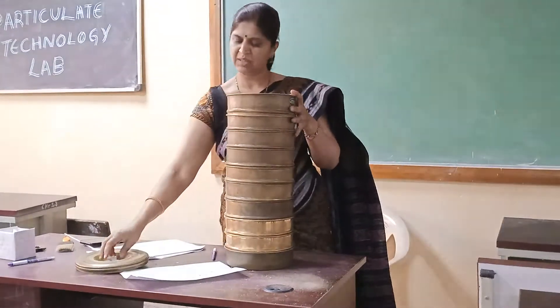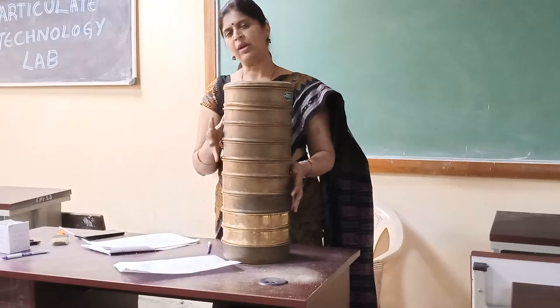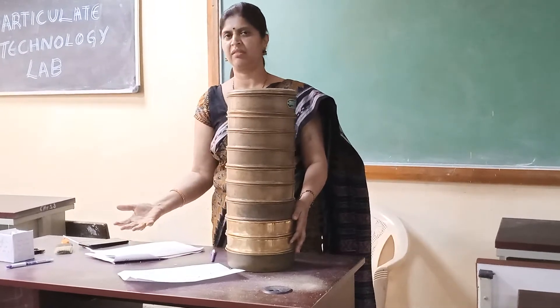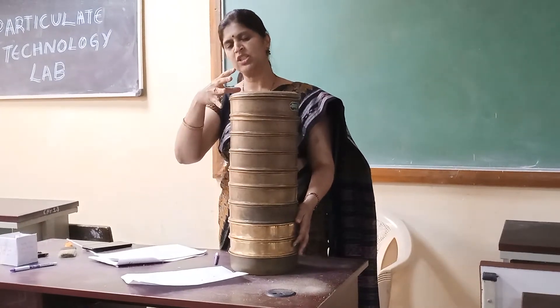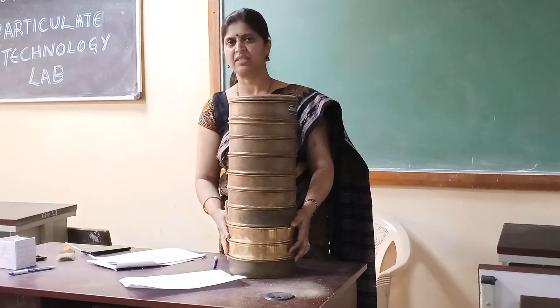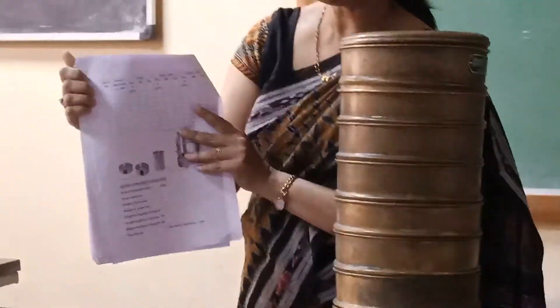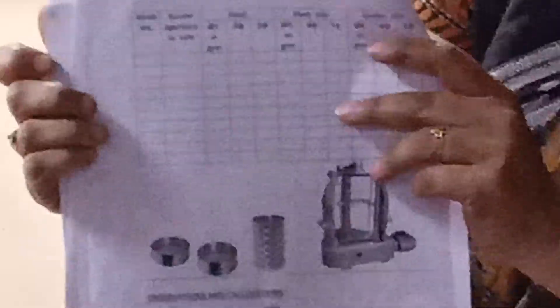The oversized material retained on the particular screen is again shaken for 10 minutes, and what is retained on each respective screen is weighed on a weighing balance. Similarly, the undersized material from that particular screen number 8 is also again sieved through a set of screens arranged according to number and size. You have to tabulate the weight retained on each screen for the feed material, oversized material, and undersized material.